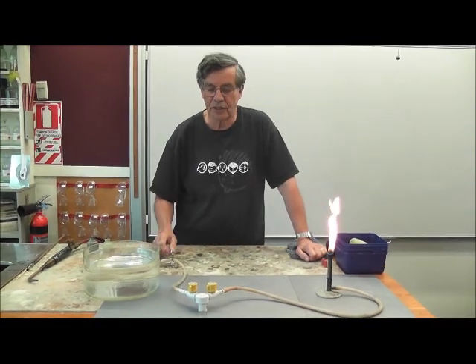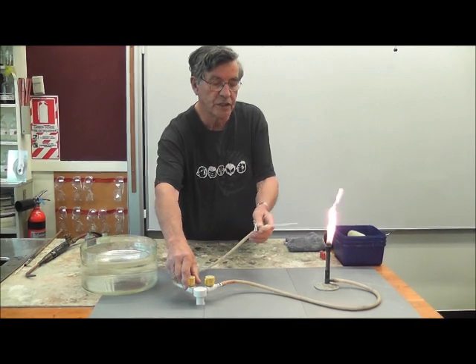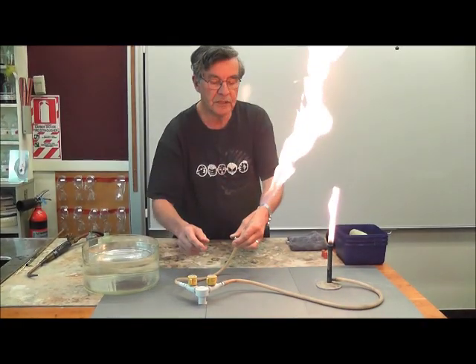In this experiment we're going to have a look at the combustion of propane. We've got propane in the gas line here and we can proceed to show its combustion as you can see there.